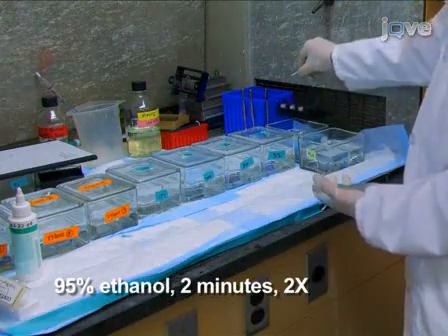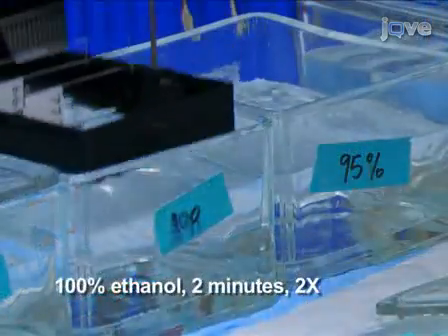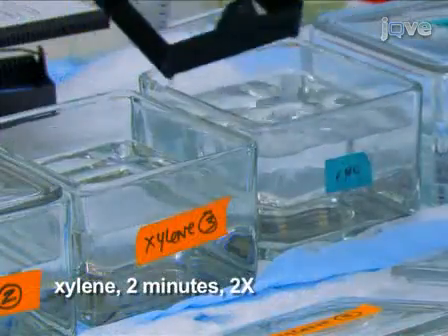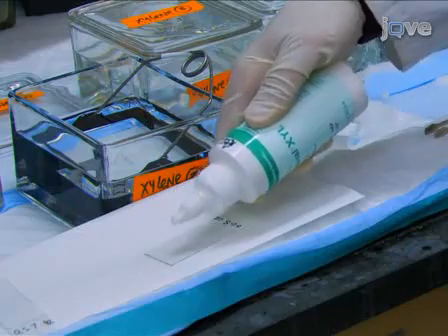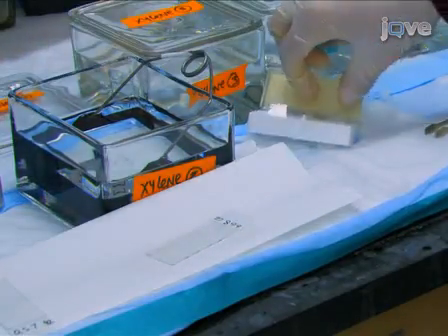Dehydrate the slides 2 times for 2 minutes each in 95% ethanol, 2 times for 2 minutes each in 100% ethanol, and 2 times for 2 minutes each in xylene. Finally, add a couple drops of mounting medium to each slide and apply a cover slip.